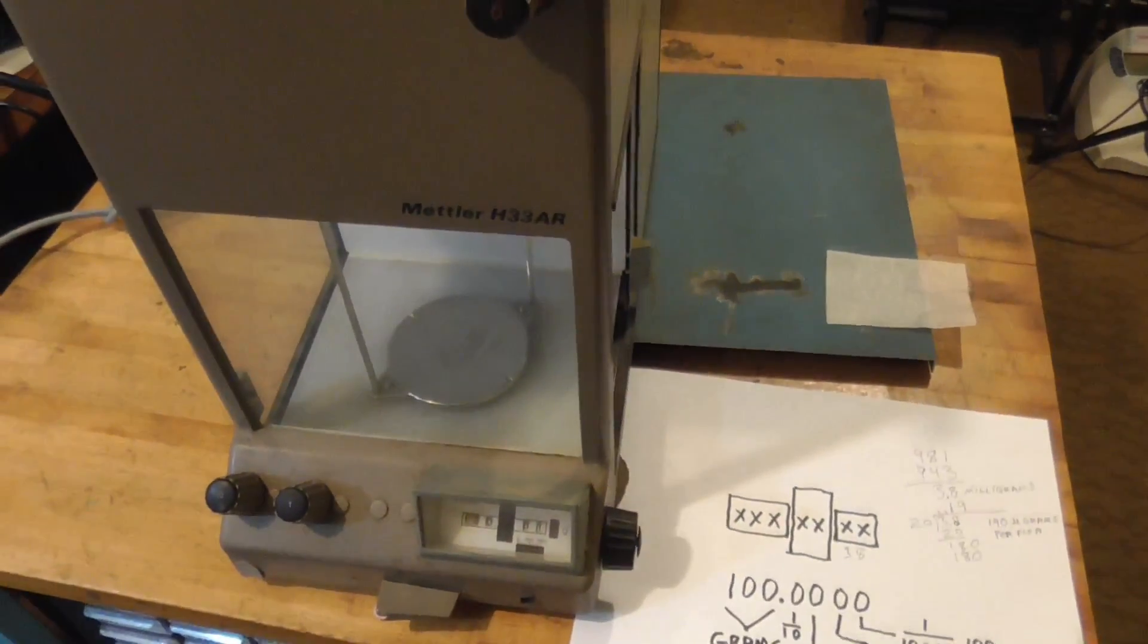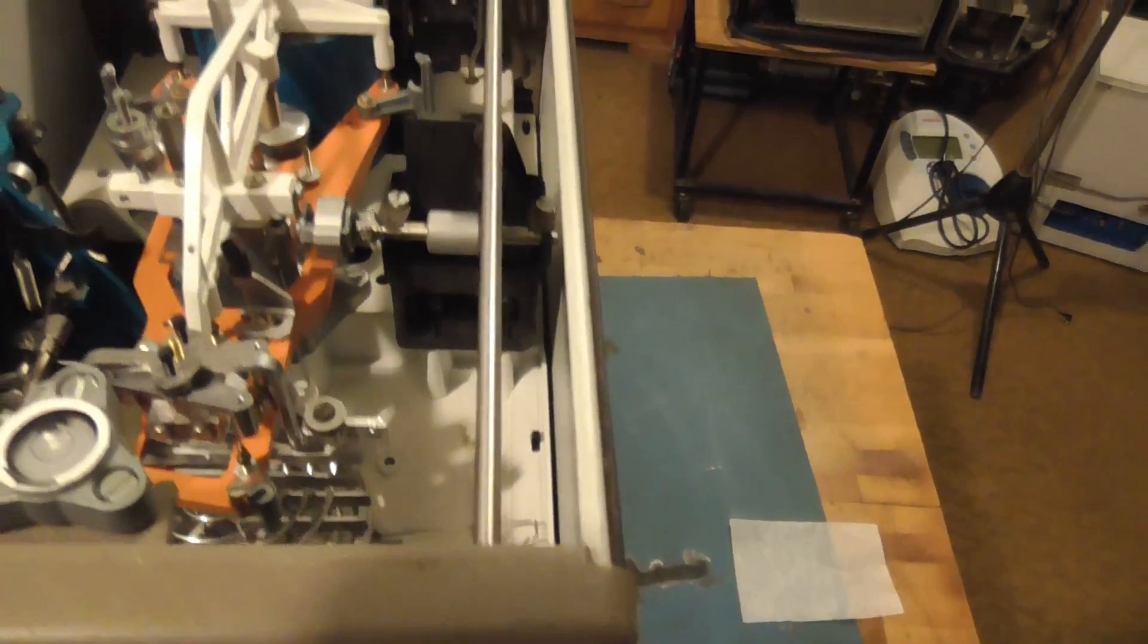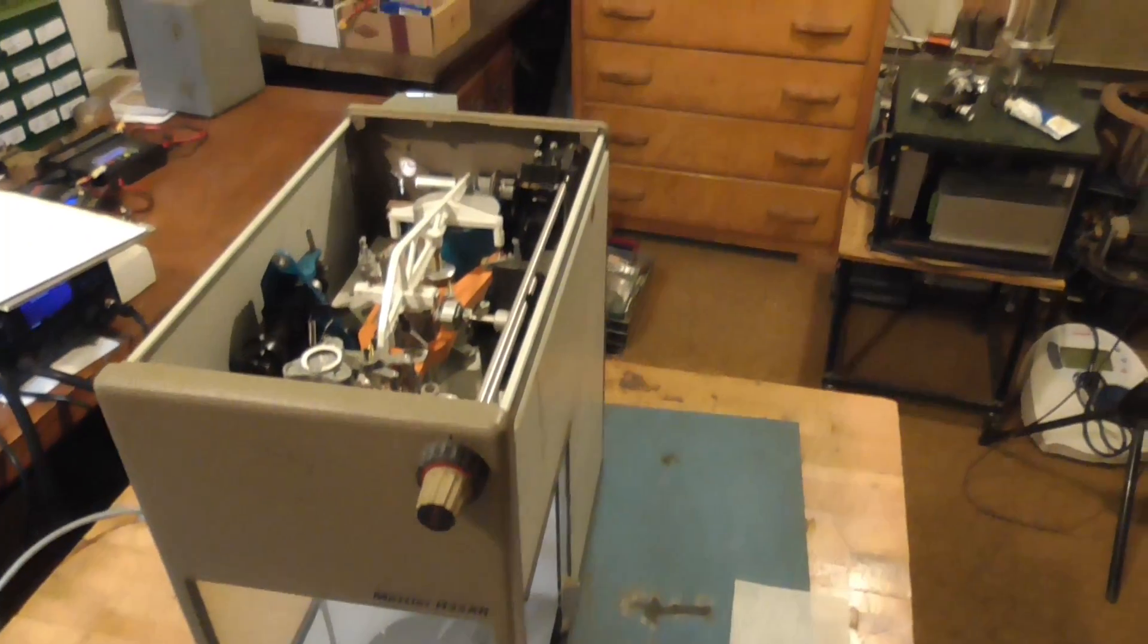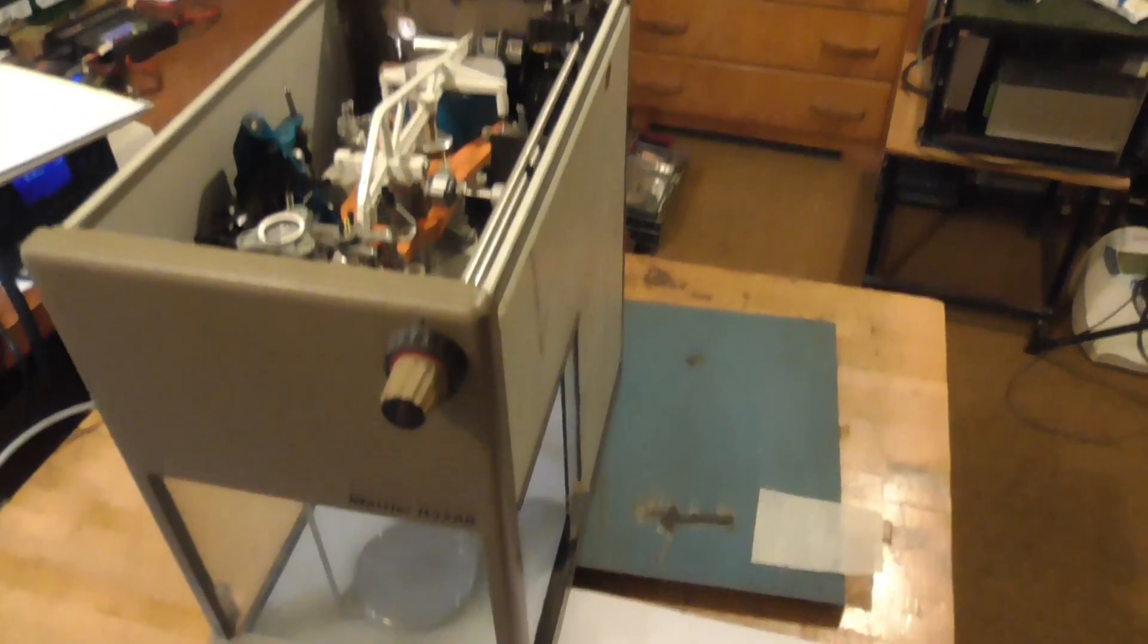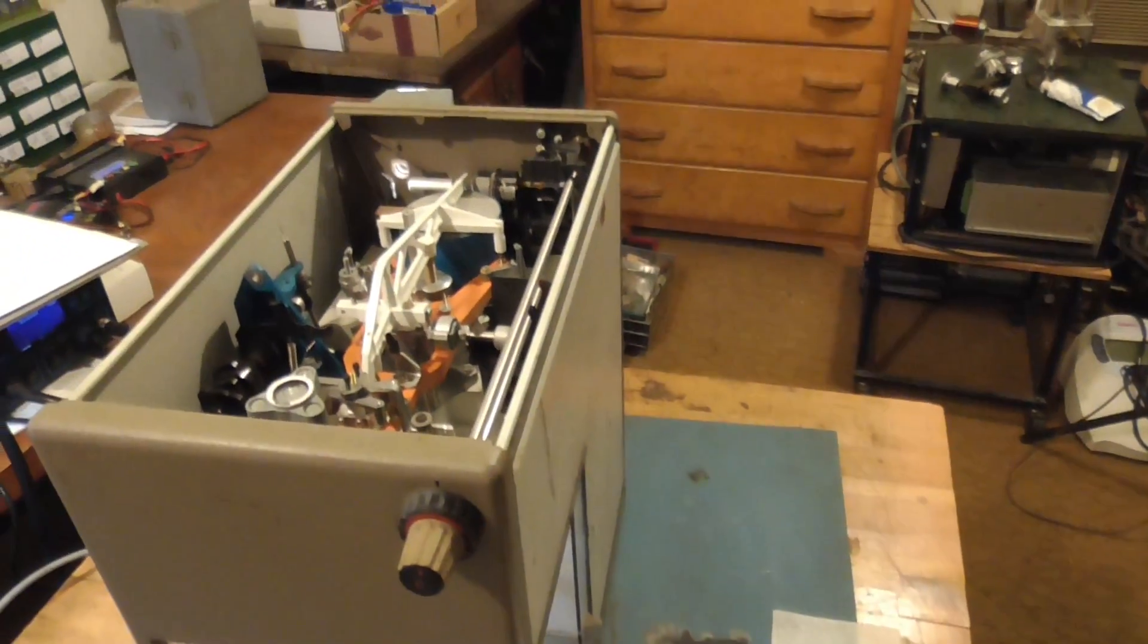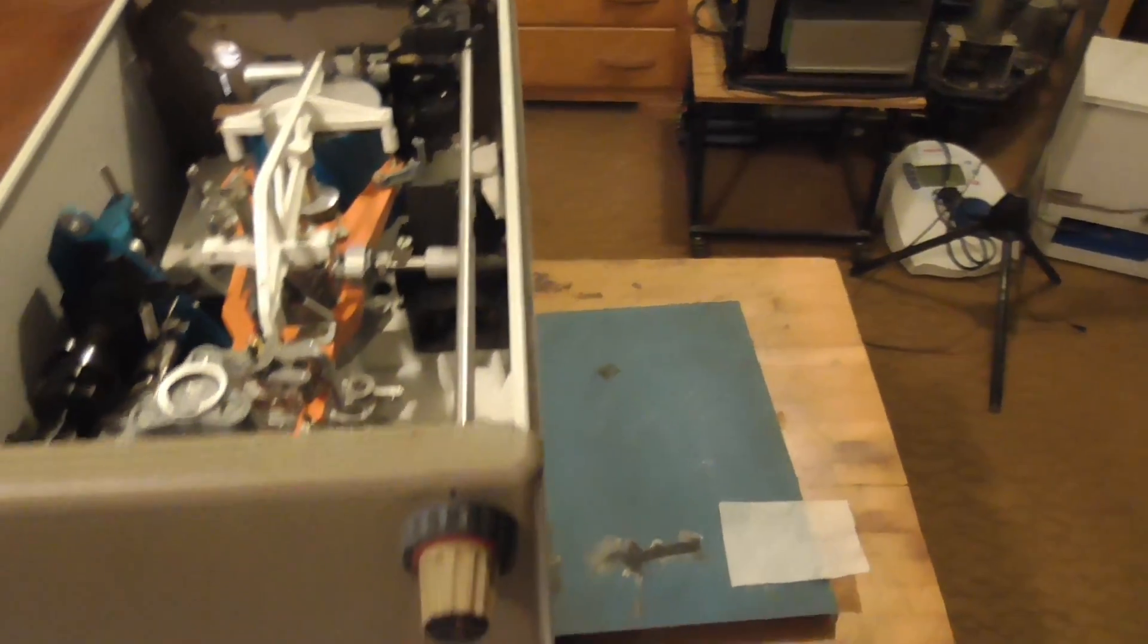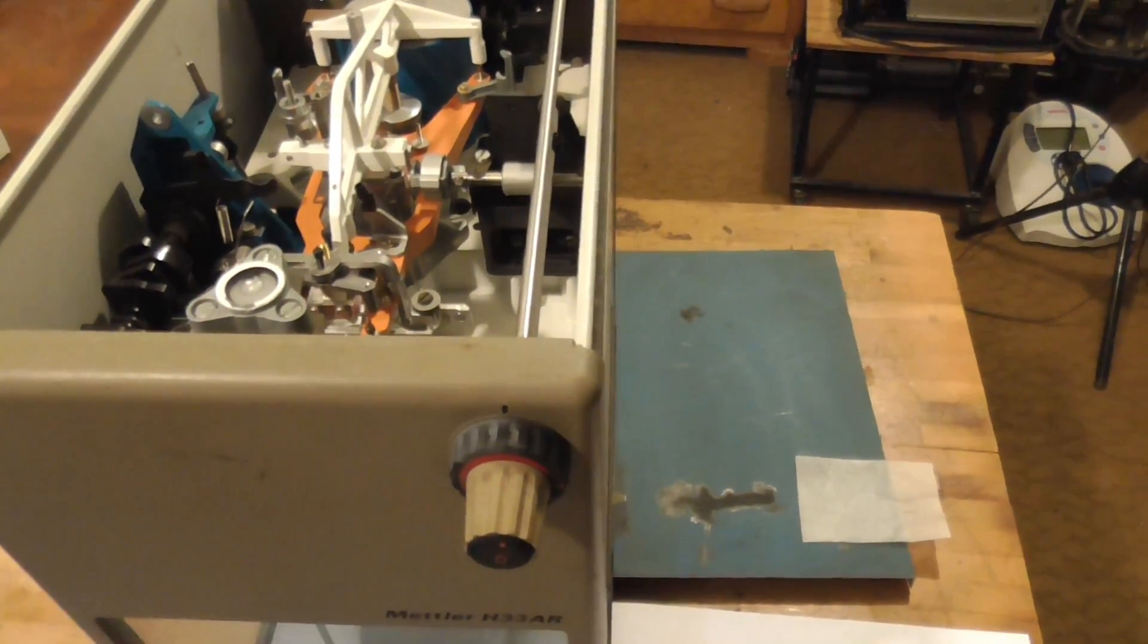Well, that's it. We figured out how to weigh the weight of a flea using a semi-antique scale or balance, analytical balance. And this poor old scale is going in the dumpster next week when the garbage truck comes. It'll haul it off to the landfill and that's the end of a really interesting piece of history. I hate to get rid of it like that, but I don't have room to store it. I need the space and I certainly don't have any use for it. I mean, what am I going to do? Sit here and weigh fleas. All right, that's it.